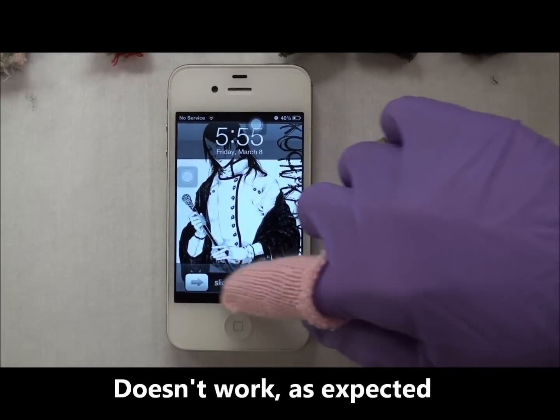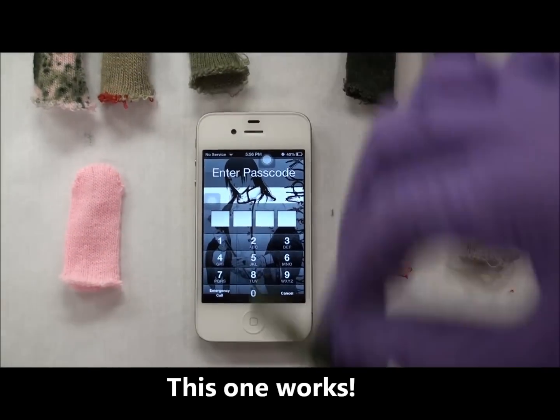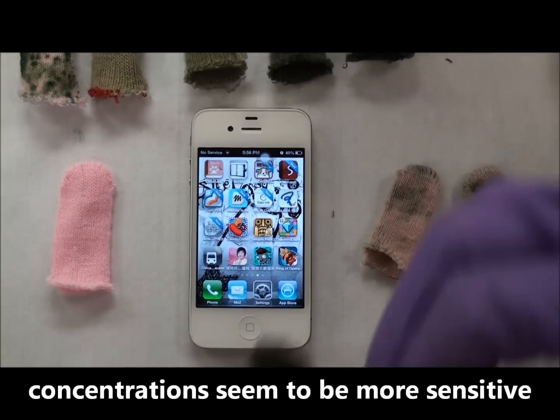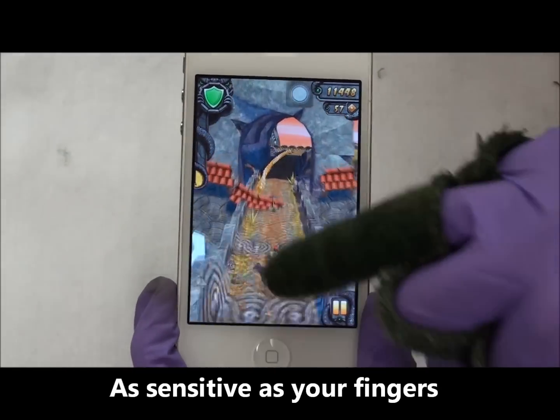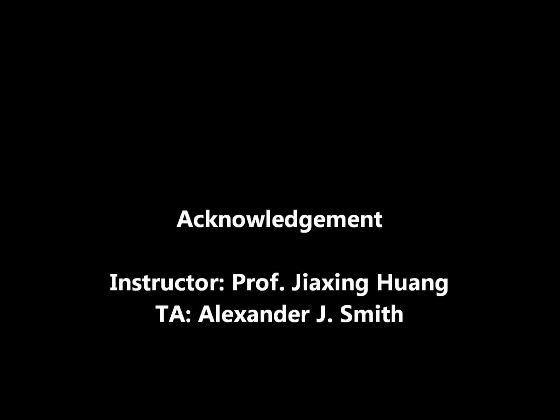Test the glove on a screen. Touch the glove on the bottom, and touch directly with your fingers. I'll see you tomorrow.